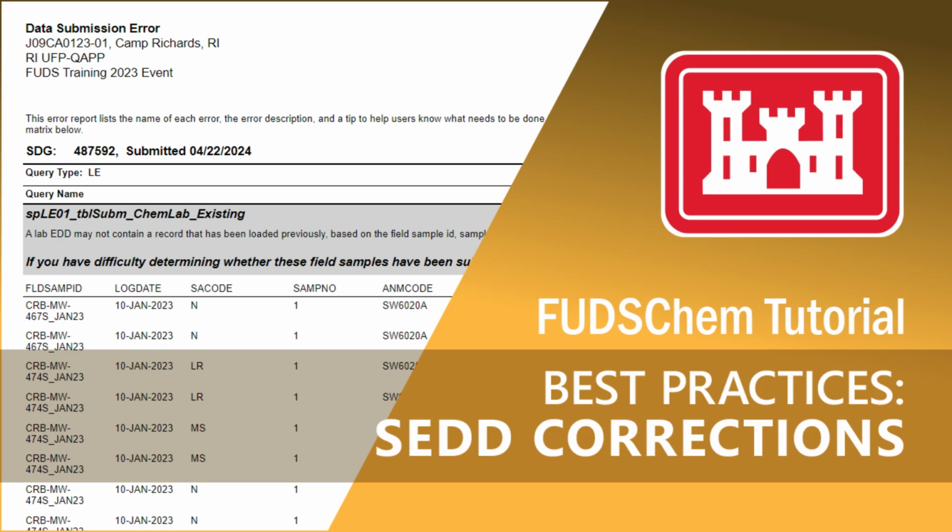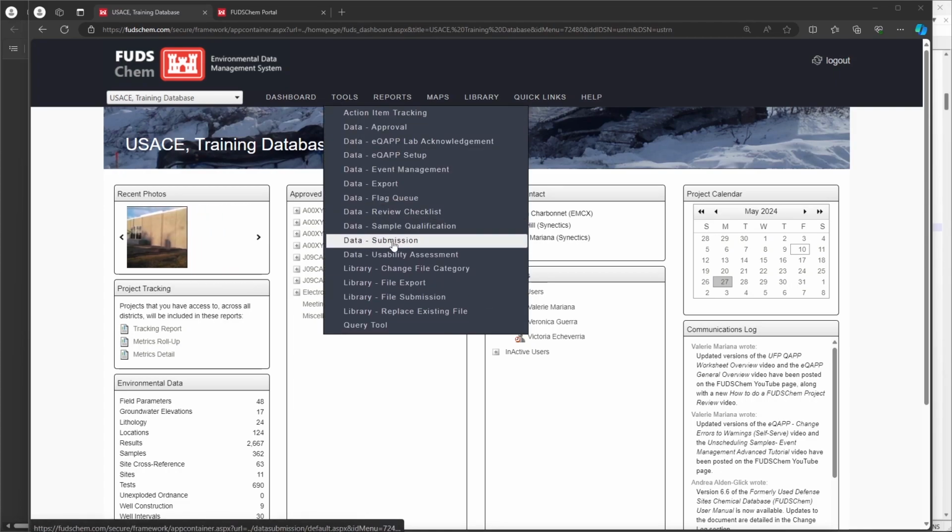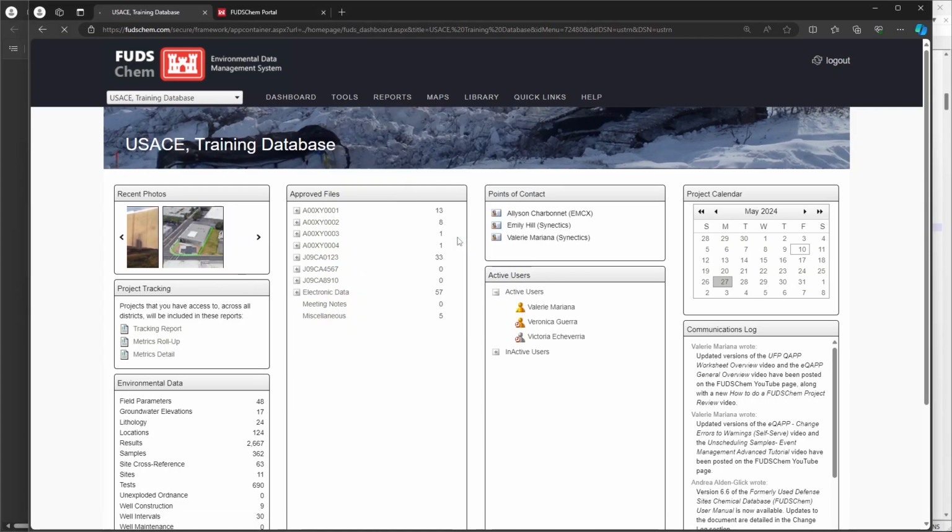This video will go over best practices for correcting SEDD files. For FUDSChem projects, the USACE requires labs to submit their laboratory data in SEDD 5.2 format, Stage 2A. This is done under Tools, Data Submission.